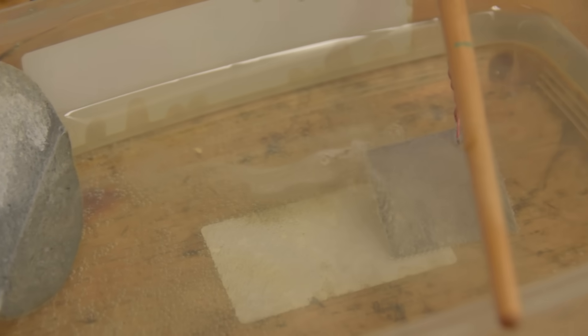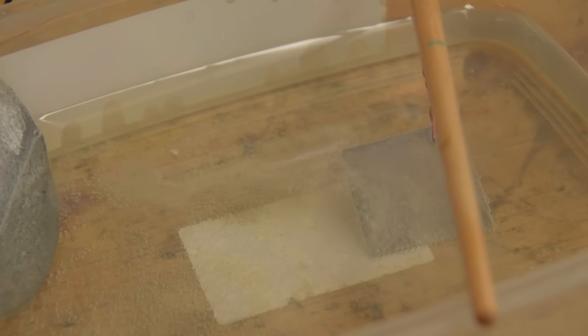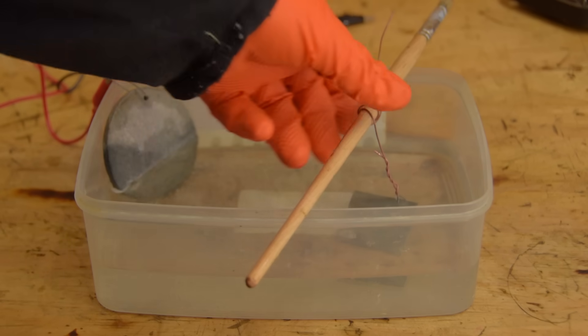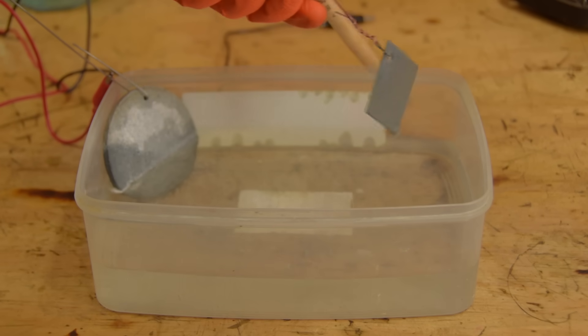Well, it's bubbling, so if there is zinc in the electrolyte, it'll be plating. You can see it's turning a dull grey, which is zinc. So yep, no problem.